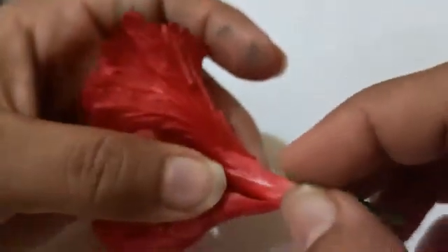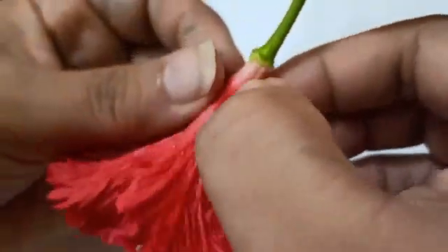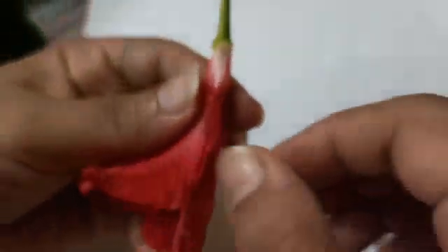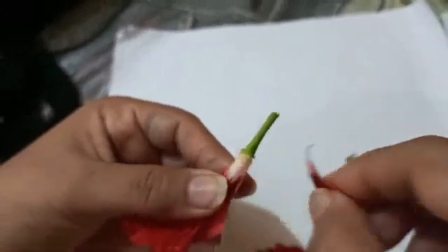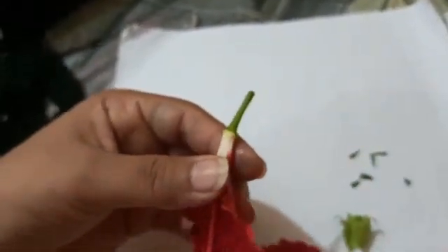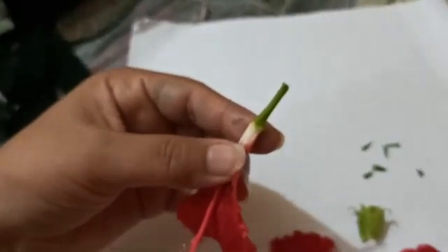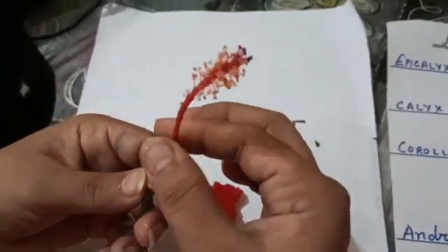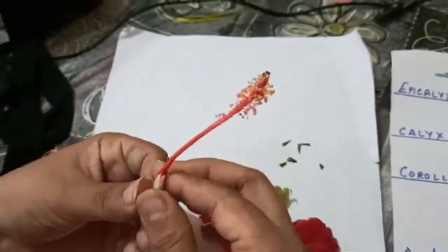After the calyx we have the corolla; the singular term is petal. You can observe that there are five petals. I'm going to remove them one by one: one, two, three, four, five. So five petals make the third whorl of this flower, which is the corolla.